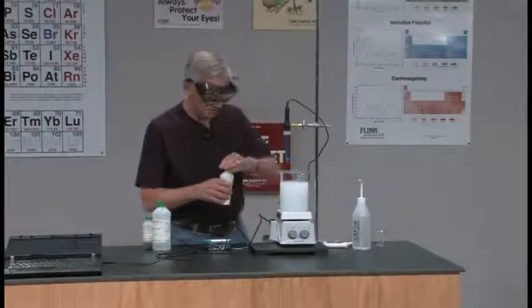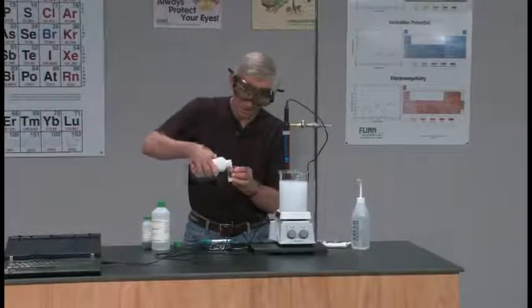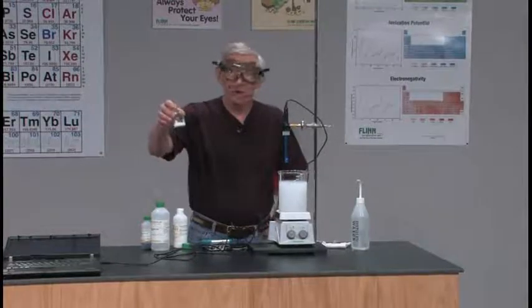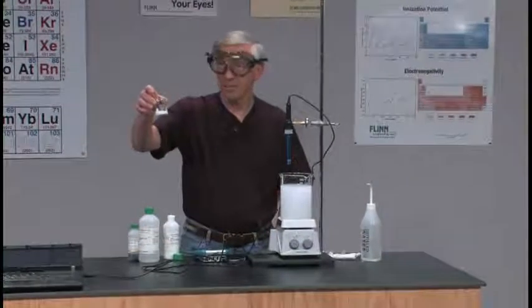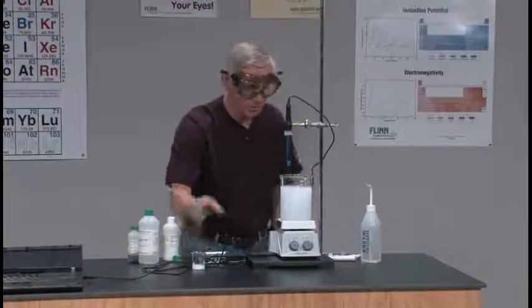If I put just a little bit of the milk of magnesia in just a beaker, clearly not very soluble. But, and if we can go over to the board, we can talk about this.